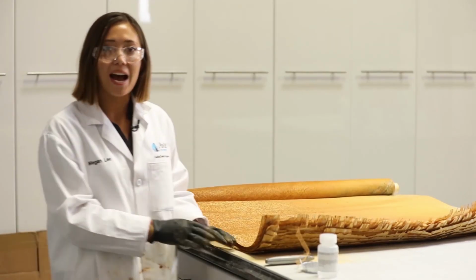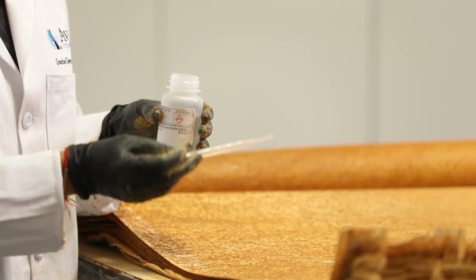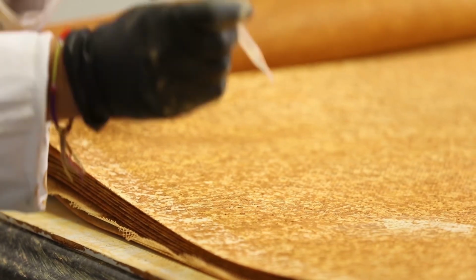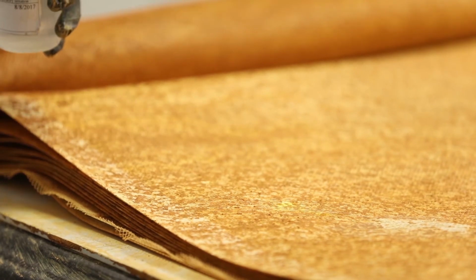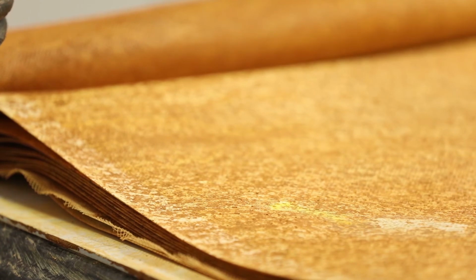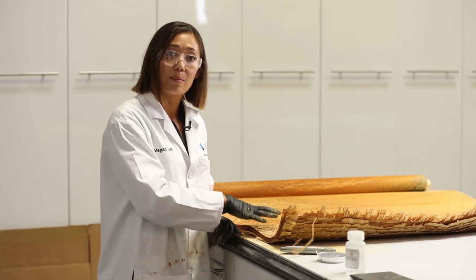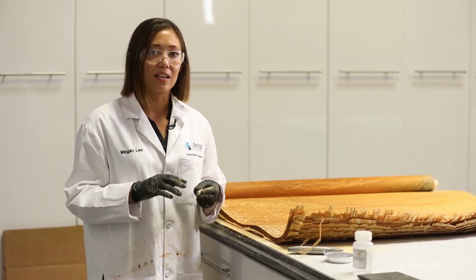We'll also perform acid testing, which tells us whether there are metals present on the membrane surface. So we'll put a couple of drops of dilute hydrochloric acid on the foulant on the membrane surface, checking for effervescing or bubbling, which would mean carbonates, or a yellow color change like we see here, which means positive for the presence of metals. Now it's time for us to harvest samples from the full element to take into our lab for performance testing and cleaning studies.